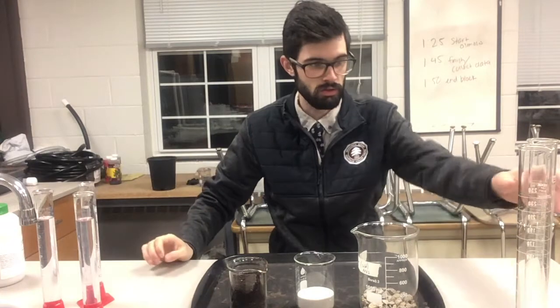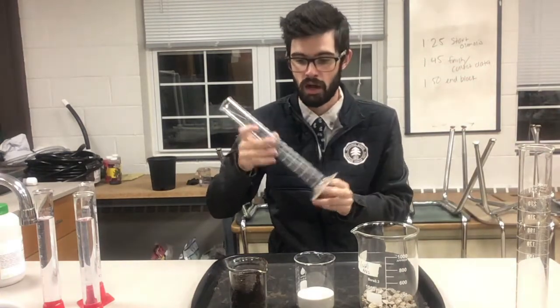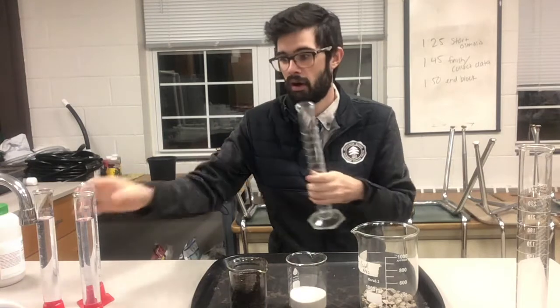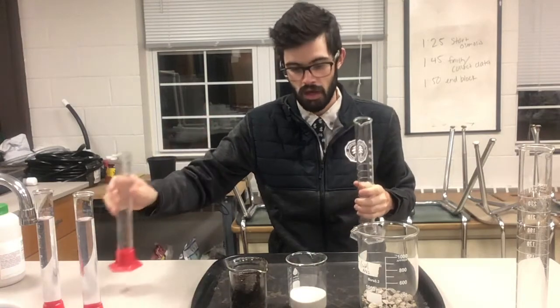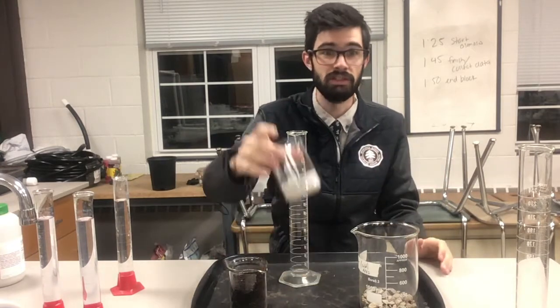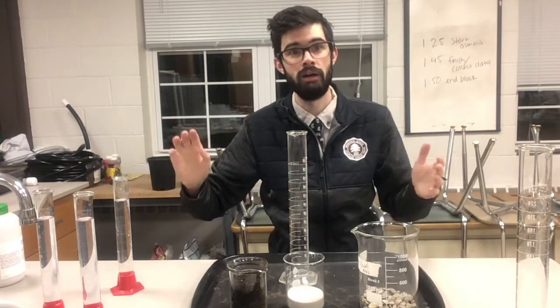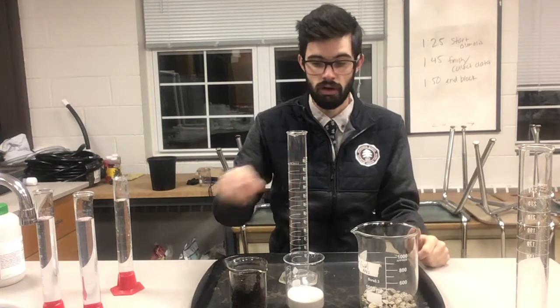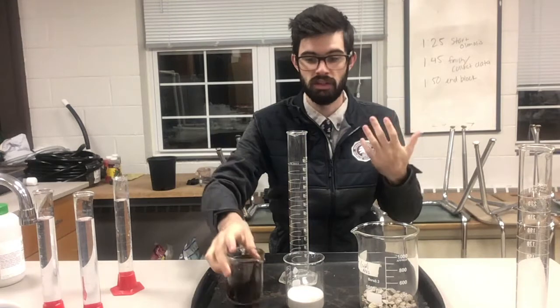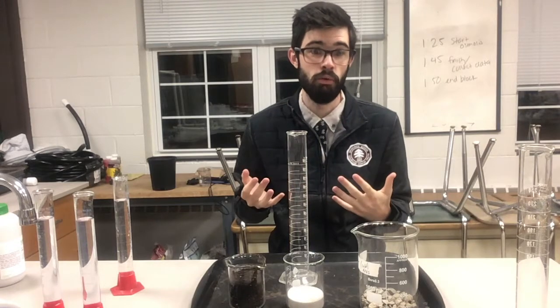Basically what I'm going to do is take a 250 milliliter graduated cylinder and fill it with about 50 milliliters of the substrate, then pour in about 100 milliliters of water. In theory, if the pore space was zero — if there was no space in between the pores, if this was a complete solid — the 50 milliliters of substrate and 100 milliliters of water would add up to 150 milliliters total. But there's space in between each particle, so water is going to seep into it and fill up some of that space. It's going to be somewhat less than 150 milliliters, and that difference is going to tell us something about the pore space.